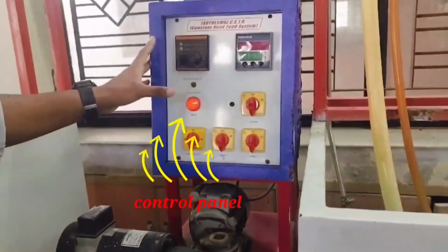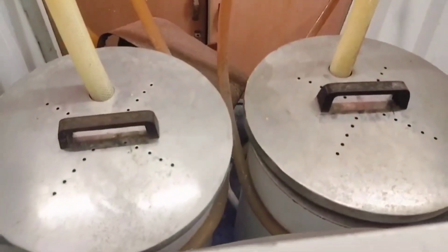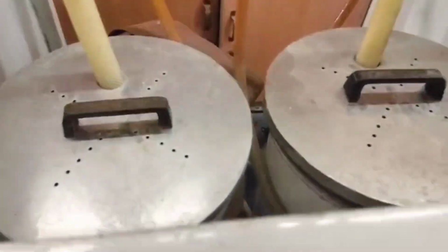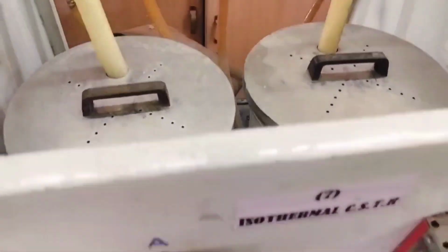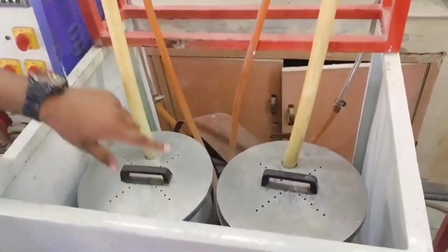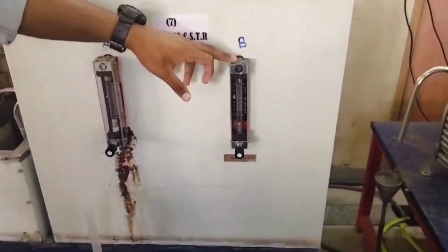First of all, prepare known molar concentrations of sodium hydroxide and ethyl acetate in separate feed tanks, because precise concentrations ensure reproducibility of the experiment. For a second order reaction, both reactant concentrations significantly affect the reaction rate. Keeping them known and consistent allows for accurate calculations of the rate constant. And label the tanks clearly as A and B.